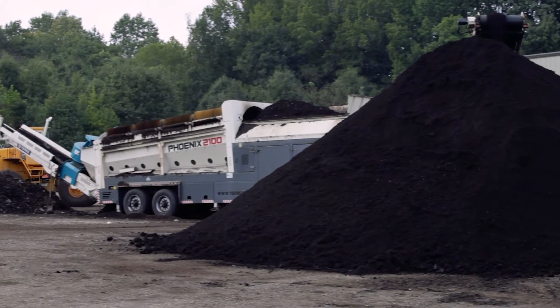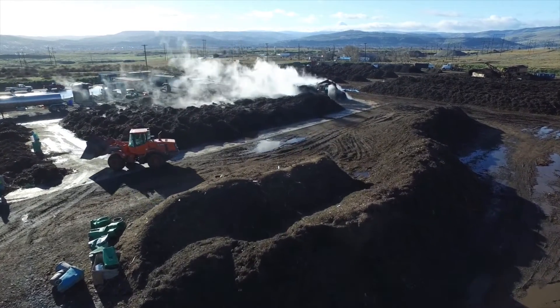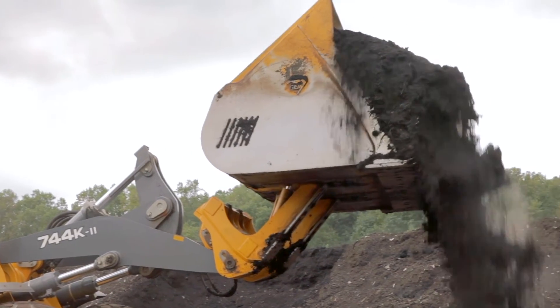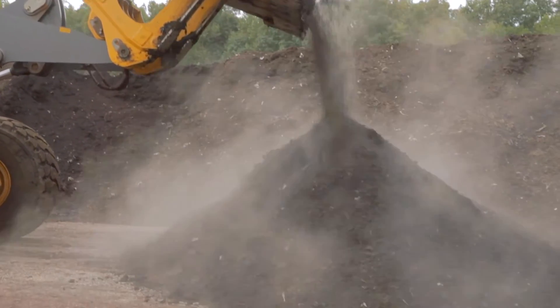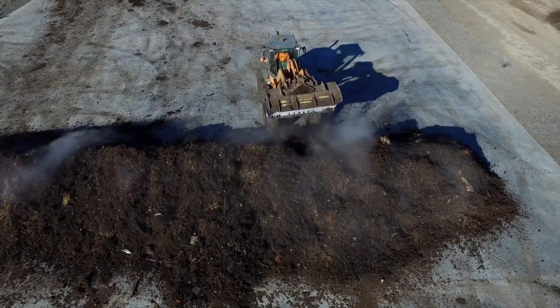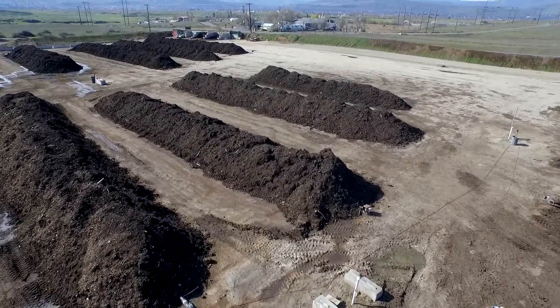This video provides guidance for sampling finished compost. For the purposes of this guidance, we are assuming that the finished compost has gone through curing and that, with the mixing that has occurred during composting, curing, and screening, as well as all of the mixing occurring during transport between processes, the final compost is relatively homogenous. Even so, it is critical that the sample is representative of the entire finished batch of compost from which the sample is collected. The sampling location should reflect the material most representative of the compost going out for sale.